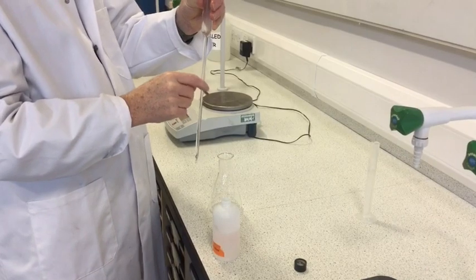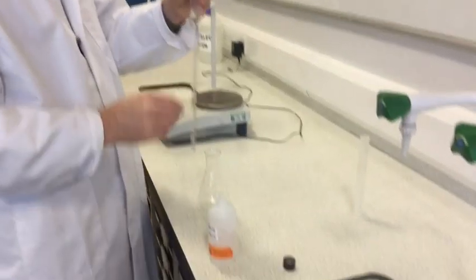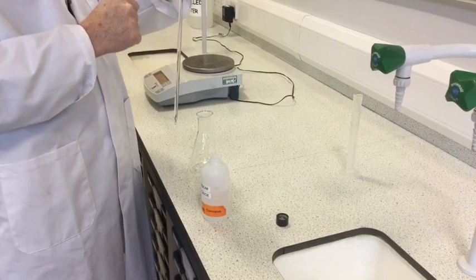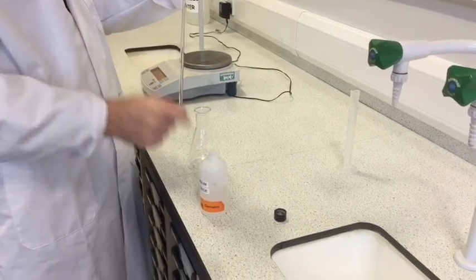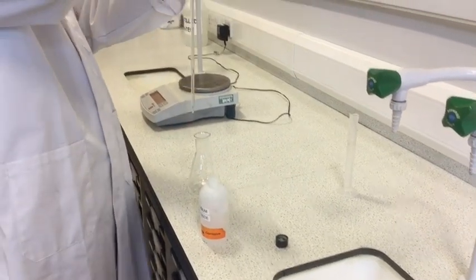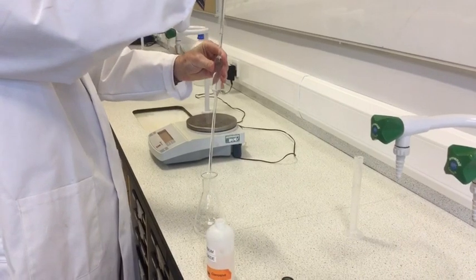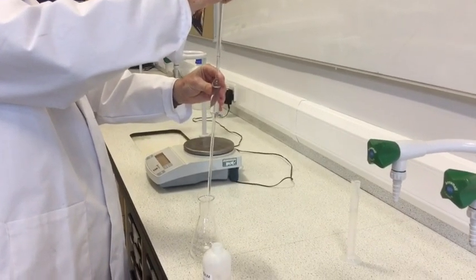I've now carefully measured out 25 mls of the one molar sodium hydroxide, having previously washed out the pipette with a small sample of the sodium hydroxide. So, now, I'll add the sodium hydroxide to the aspirin.